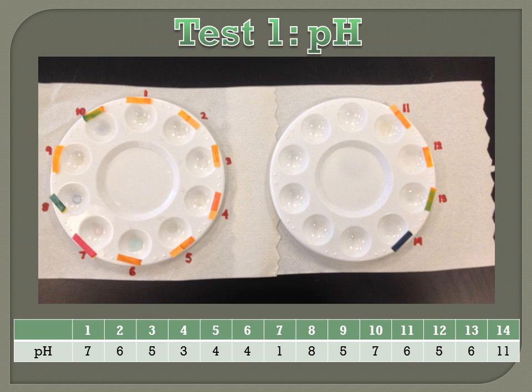The pH of a solution is determined by the solution's hydrogen ion and hydroxide concentrations. This can be theoretically found by a hydrolysis reaction of the solution's cation and anion. Our results can be shown in the table below the screen.